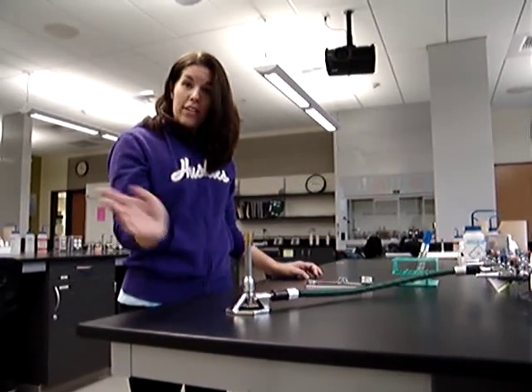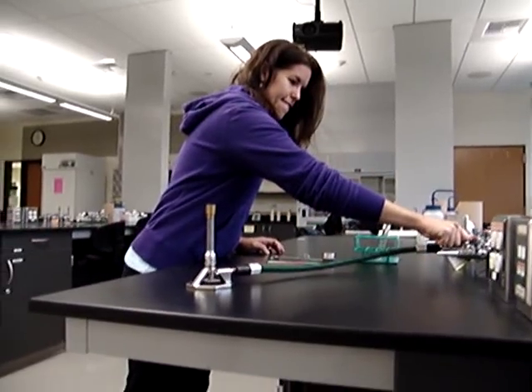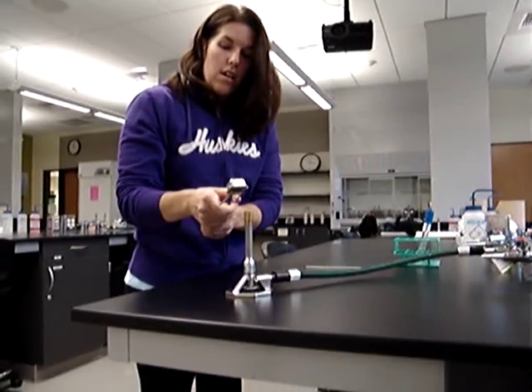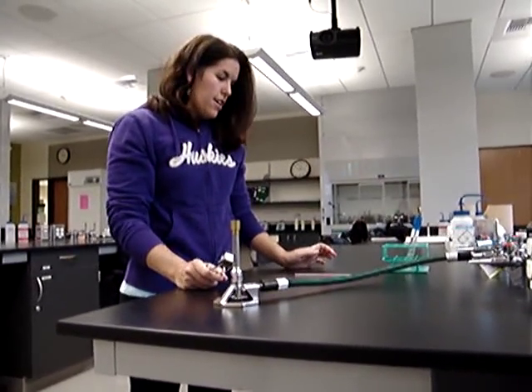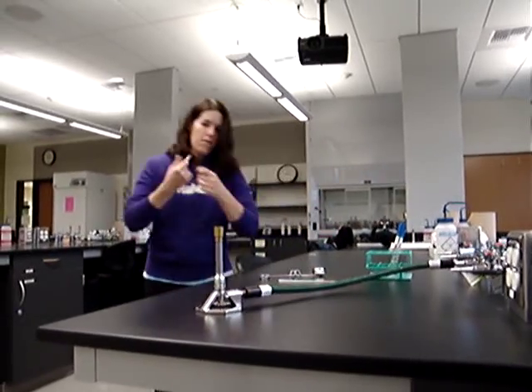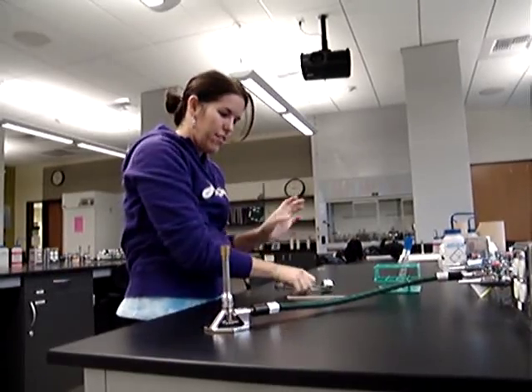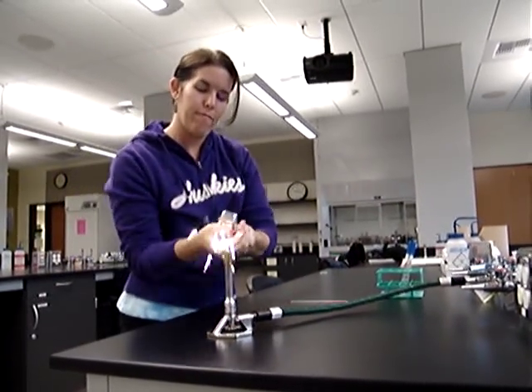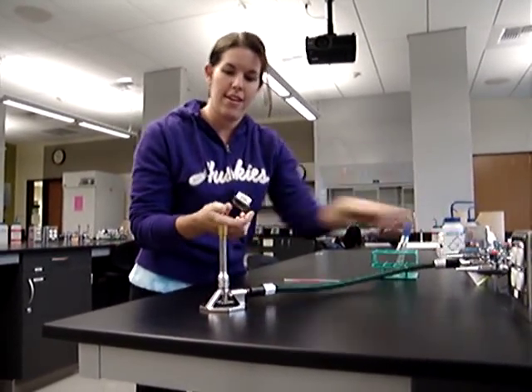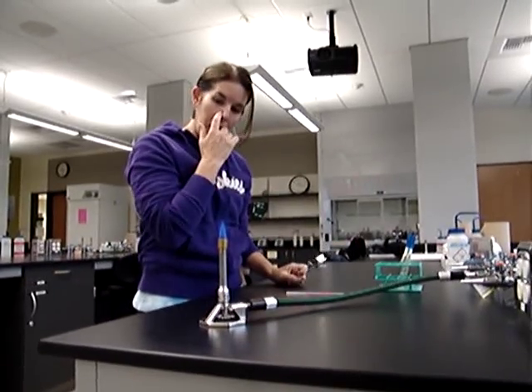We're ready to do this aseptic transfer. Do you want to put a lab coat on? Watch your hair — don't light yet because you've got some hair flowing. Maybe just put your hair back. No lab coat? Okay. You've got the gas going — there we go.